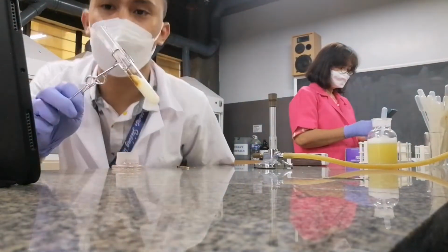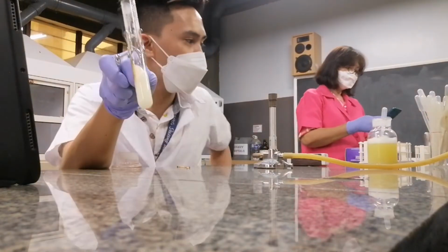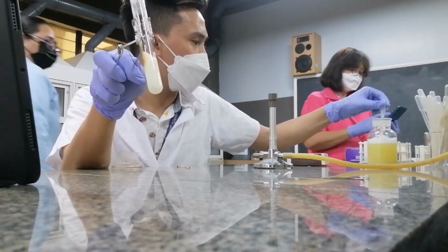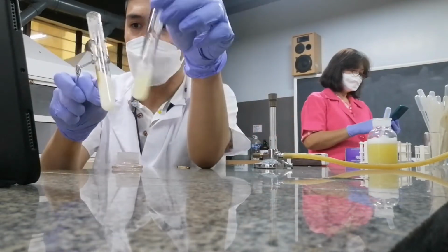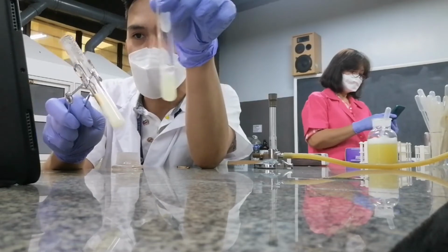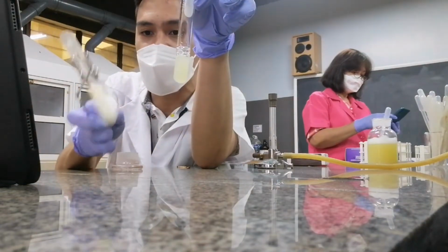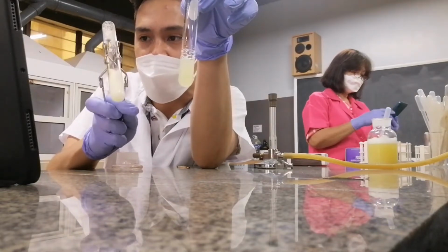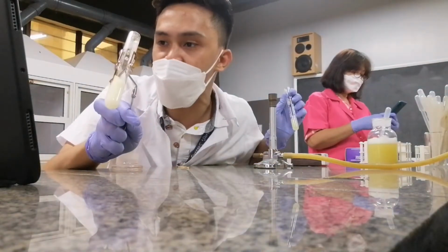Okay, try to look at now what happened to the albumin upon heating. What did you notice? Let's try to compare it before heating, so you can see. Before heating, it's actually liquid, right? Am I right? But what happens after heating, class? It actually solidifies, it clumps, no? It clumps together. So this clumping is what we call coagulation.